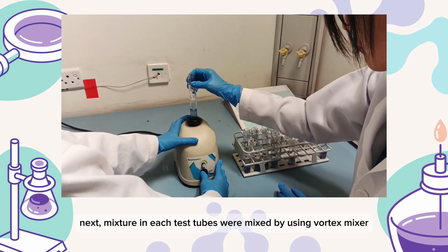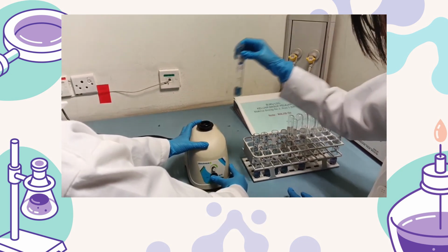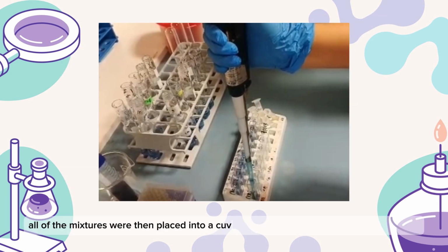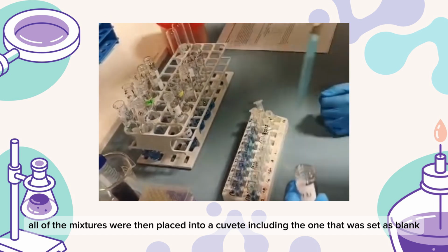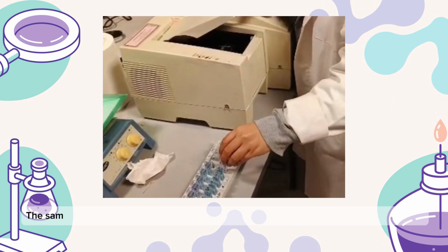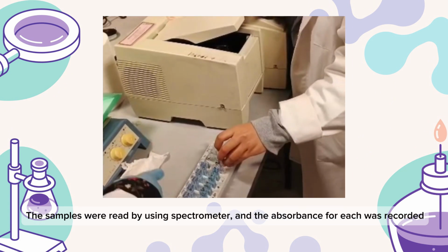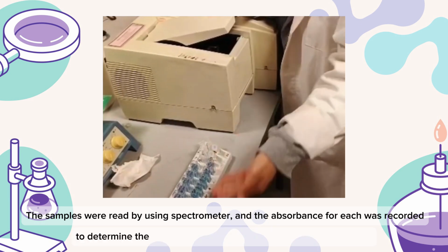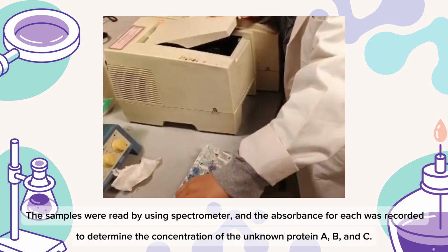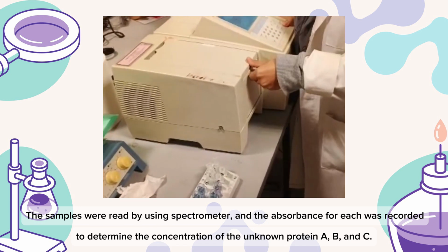Next, the mixture in each test tube was mixed by using a vortex mixer. All of the mixtures were then placed into a cuvette, including the one that was set as blank. The samples were read by using a spectrometer and the absorbance for each was recorded to determine the concentration of the unknown protein A, B, and C.